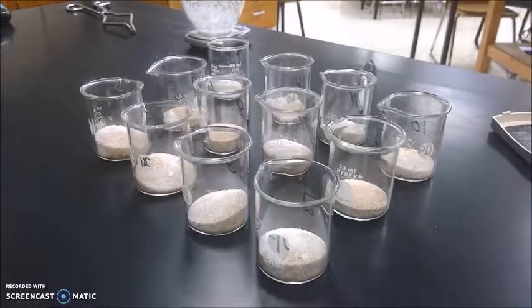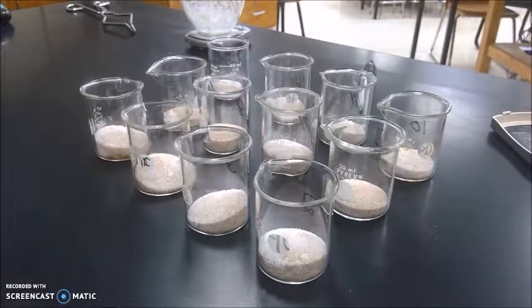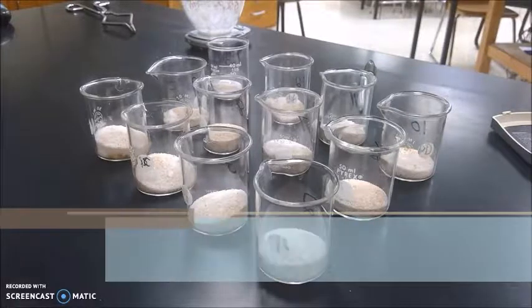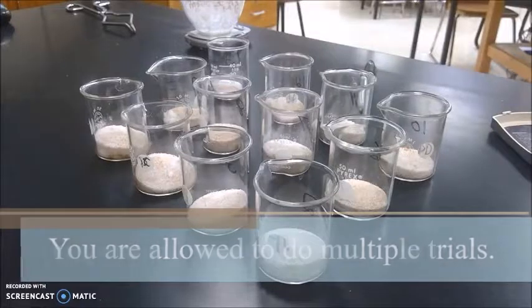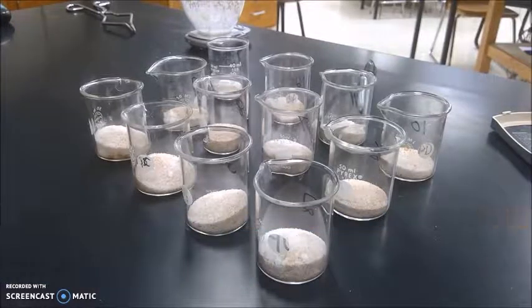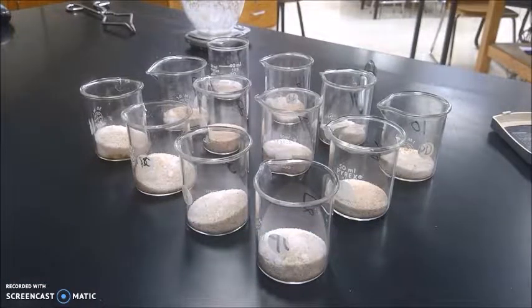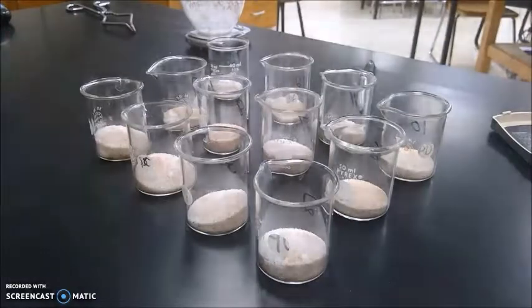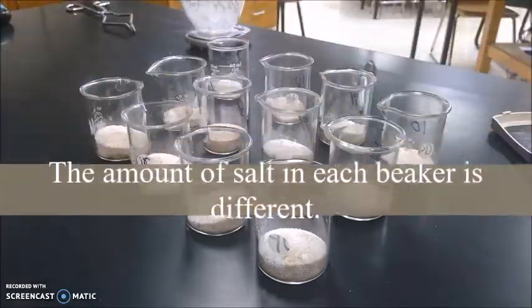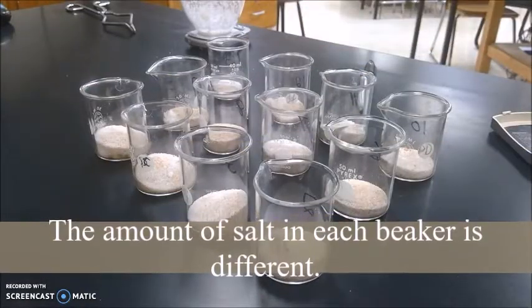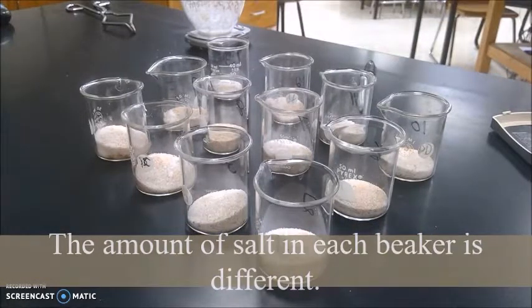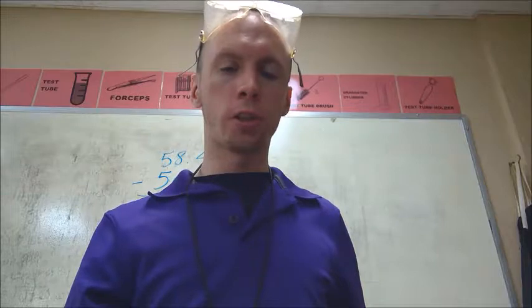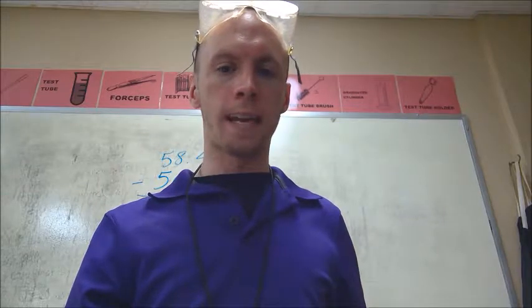Because my results weren't that great, I'm going to need to redo this lab again. And for this lab, you're allowed to do as many trials as you want to to give you the best score possible. As you can see, I've pre-prepared a whole bunch of beakers with salt and sand for you to use. Just be careful. The amount of salt and sand is different in each one. So you can't just reuse the same information.